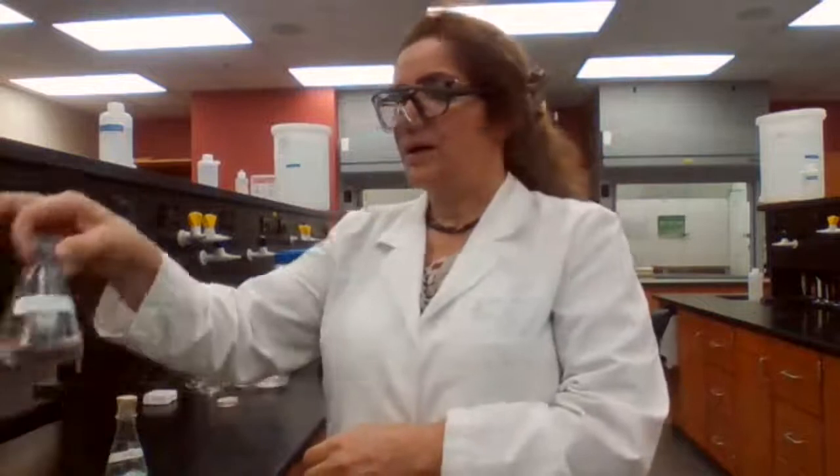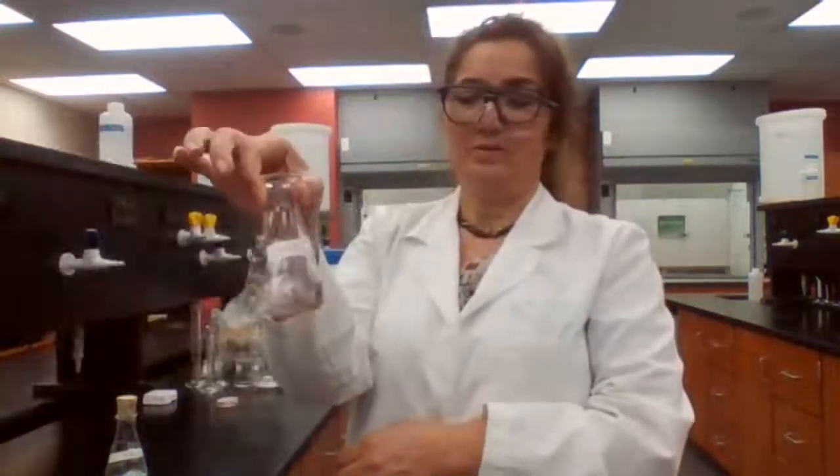The solvent dries up so we can recover the neutral compound. Our aqueous layer is sodium hydroxide. What's in here now is the carboxylate ion, basically. But when we add acid to it, the solubility of a weak acid or carboxylic acid is going to be lower in acidic solution.